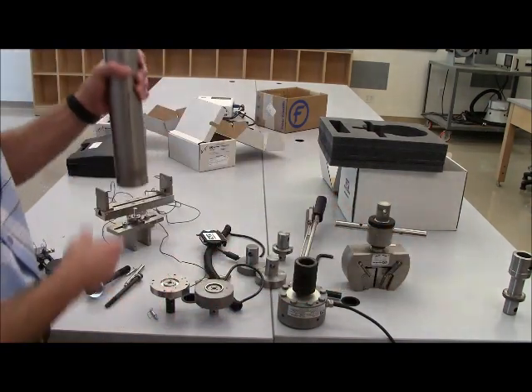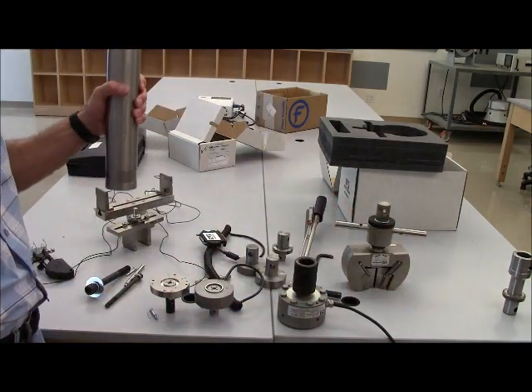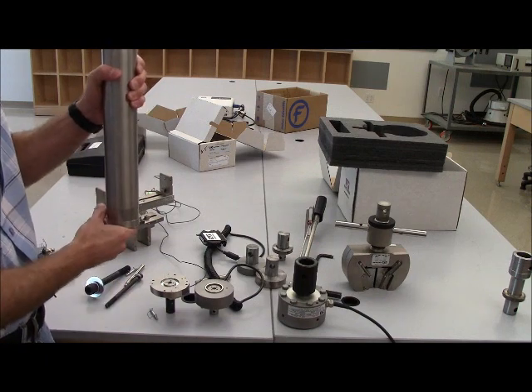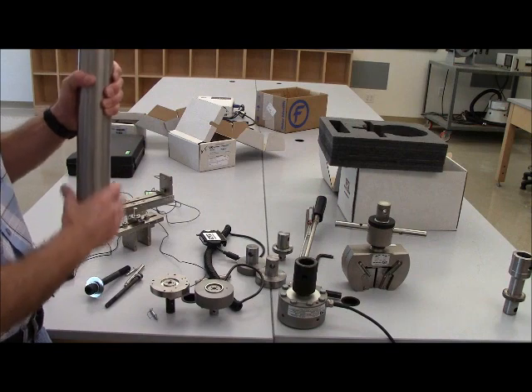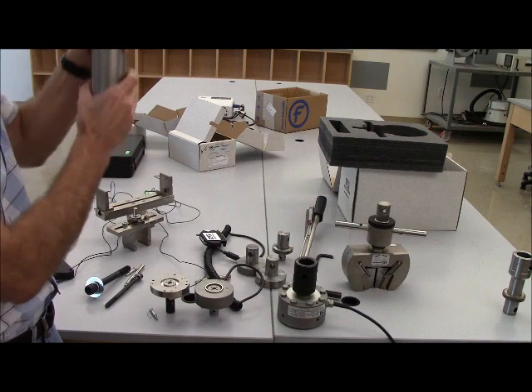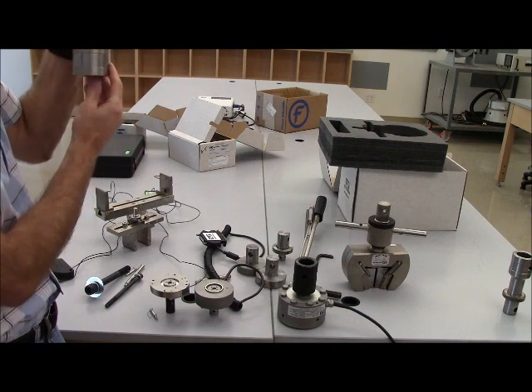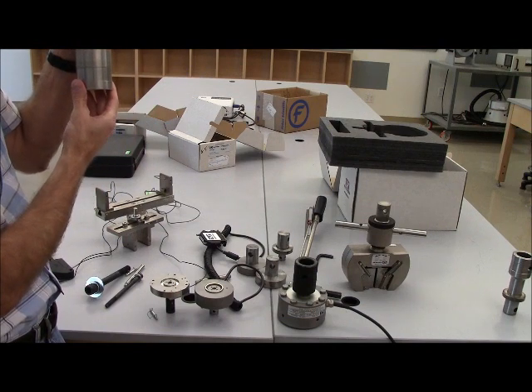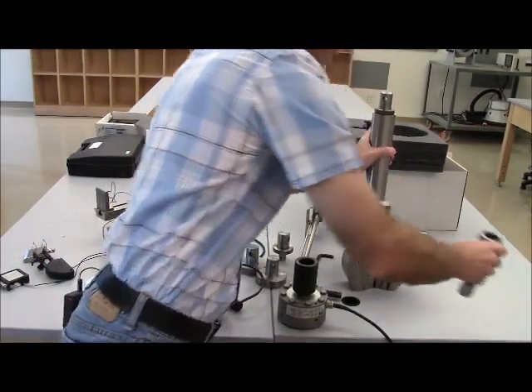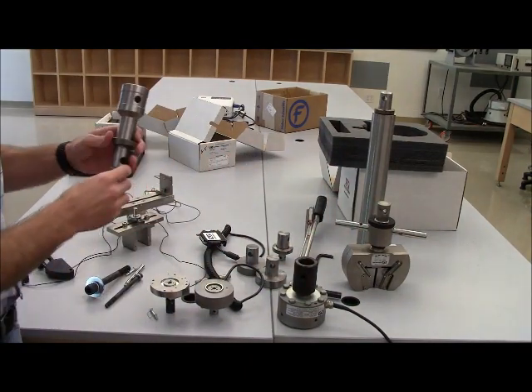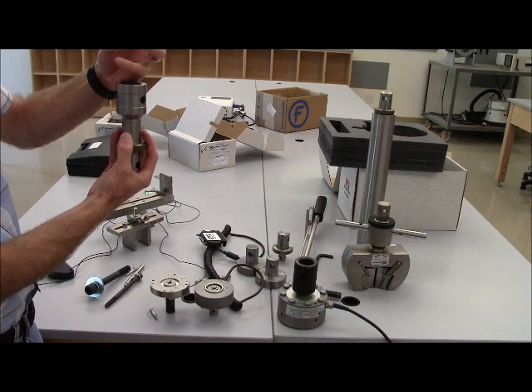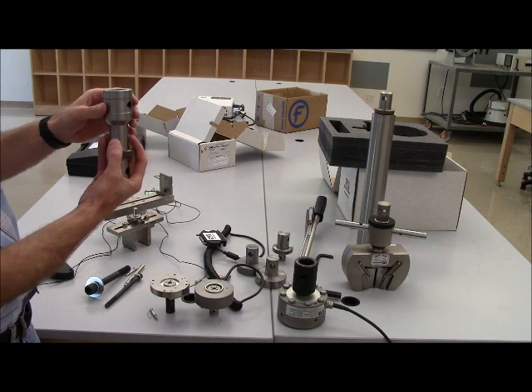This attachment is used in conjunction with the temperature chamber. In a video, I'll talk about the temperature chamber, but this pull rod attaches to the load cell, which is going to be up here, and it drops down into the temperature chamber. At this point here, you could attach, say for example, a wedge grip to hold onto the sample. This portion of the pull rod comes up from the bottom of the system, and you could put, for example, a wedge grip here inside the temperature chamber.